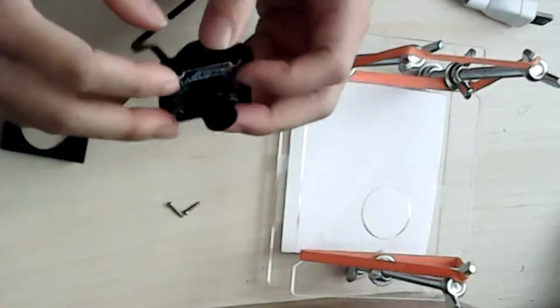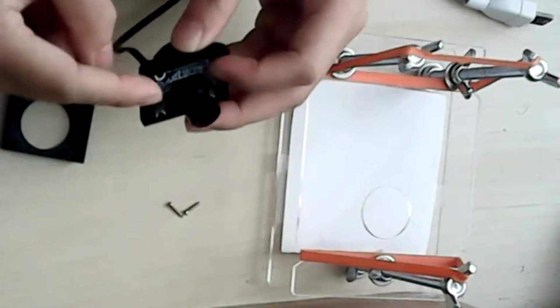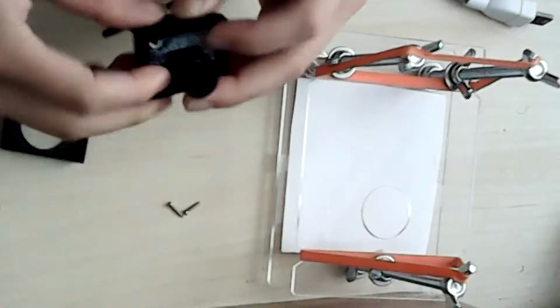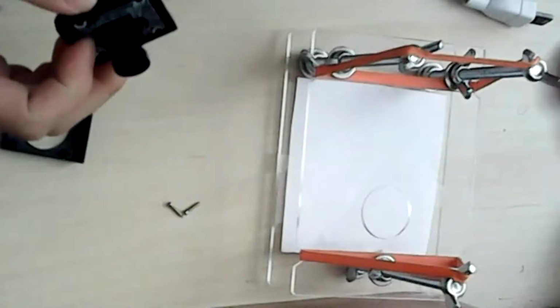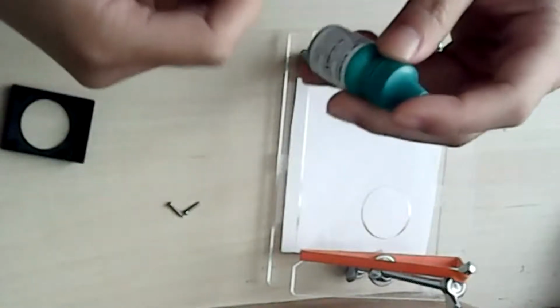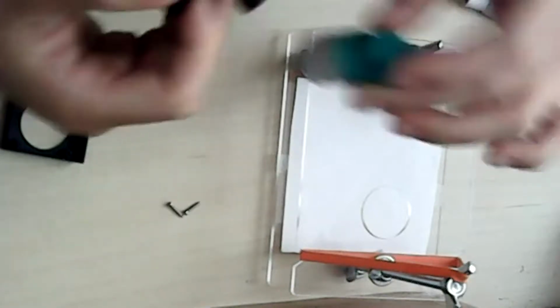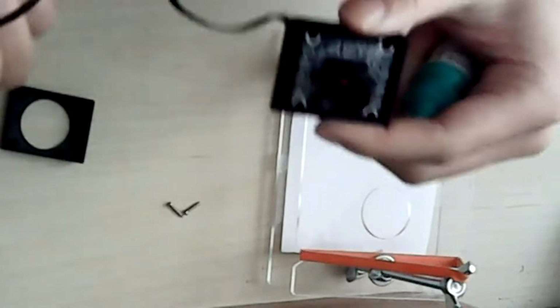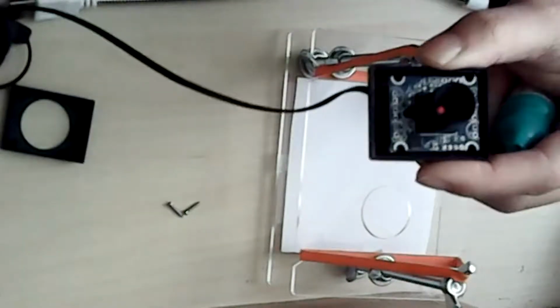And then what you will want to do here now is focus it a little bit. I've already somewhat pre-focused it. So just unscrew it 2 turns approximately, and then you can try to find something with small print. I think the thing I can find is like eye drops, and you can plug this into your computer and try to focus it so that your viewing distance is around 1 centimeter, like around the square parts. I won't demonstrate the focusing part, but all you need to do is plug this into your computer and focus it a little bit, and then if needed, we can further refine focus at the end.